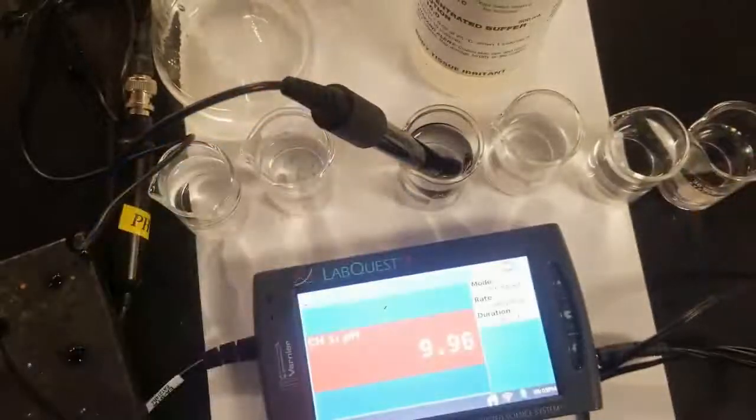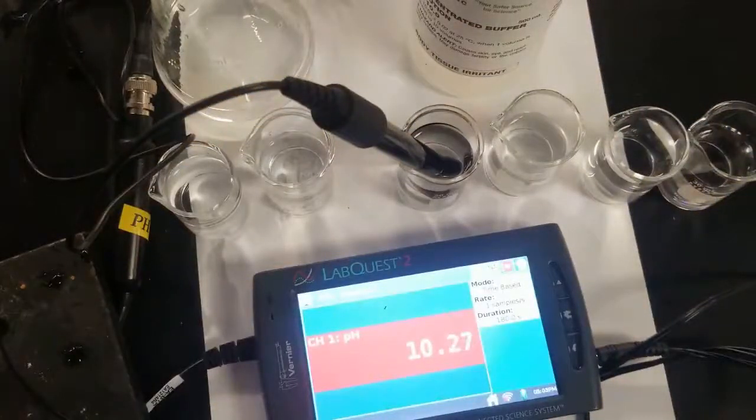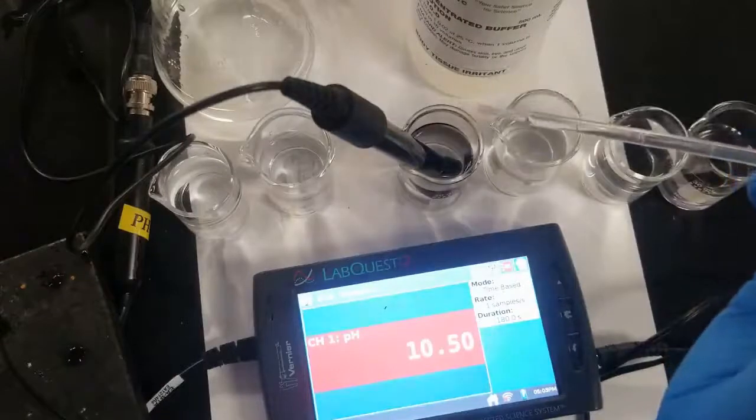So again, let's check it out with our buffer solution. So again, this is buffered. It's a pH of 10. It's a standard solution, so we can also check out how much our instrument has drifted. And you can see there certainly is some drift there, but it's not too terrible. It should be reading exactly 10. These things go through a lot of student abuse, and so they're not the best things ever, but still pretty decent. Let's add our 5 drops of base.